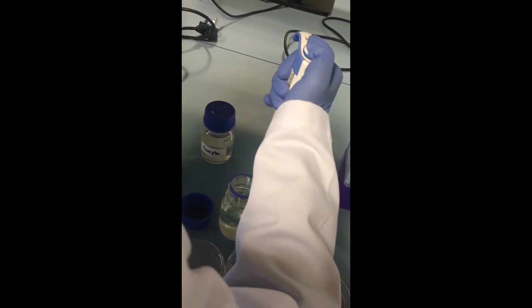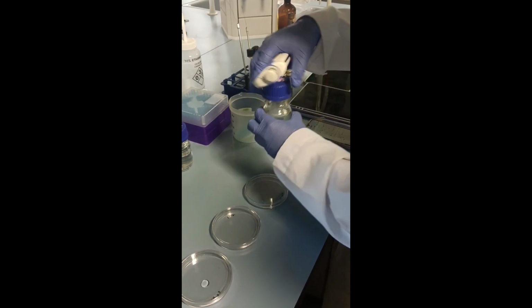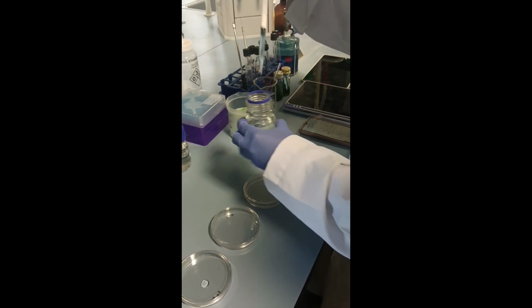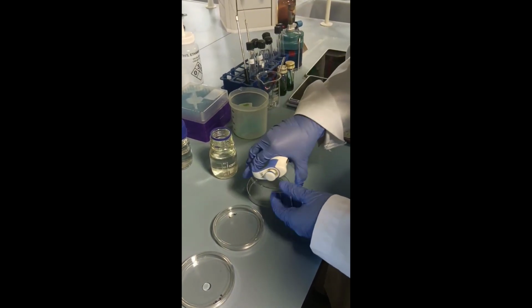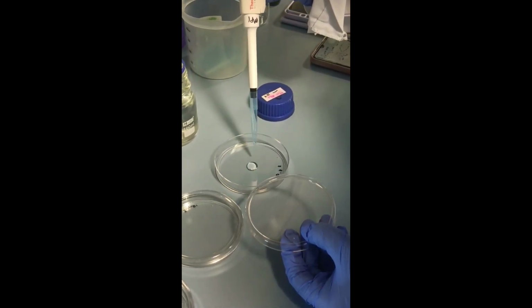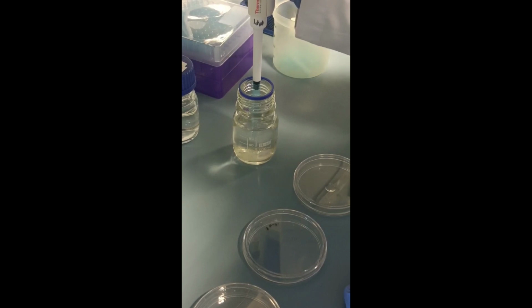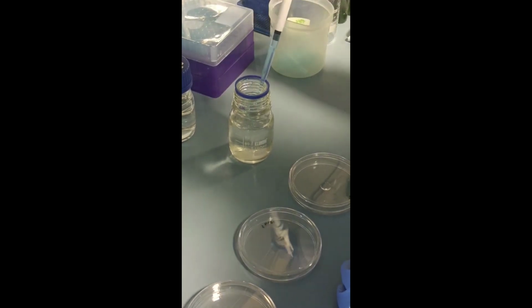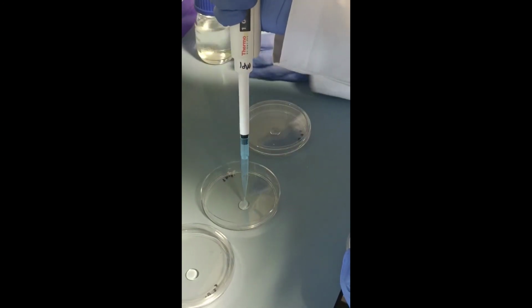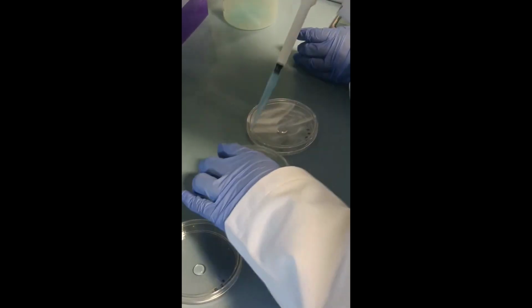Using a new sterile pipette, aseptically transfer 0.1 ml and 1 ml from the 10^-2 dilution to the agar plates labeled 10^-3 and 10^-2 respectively. With the same pipette, remove an additional 1 ml from the 10^-2 dilution blank and transfer to the 10^-4 dilution blank. Repeat the shaking procedure for the 10^-4 blank and transfer 0.1 ml and 1 ml portions from this dilution bottle with a new pipette to the plates labeled 10^-5 (0.1 ml) and 10^-4 (1 ml).